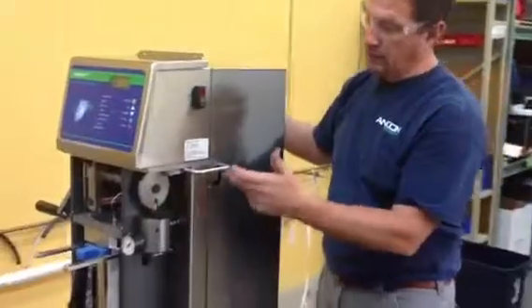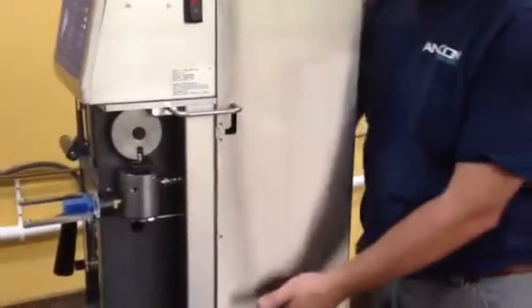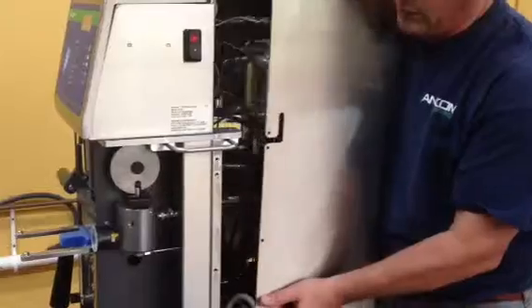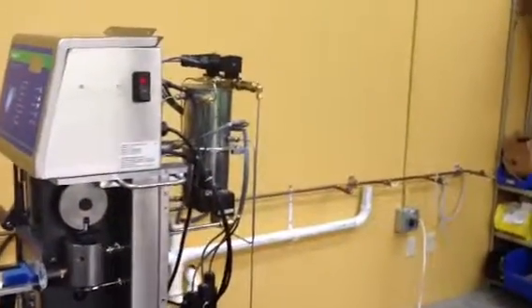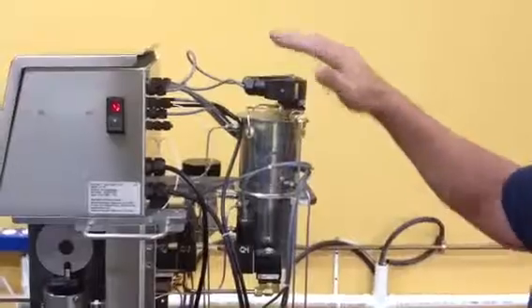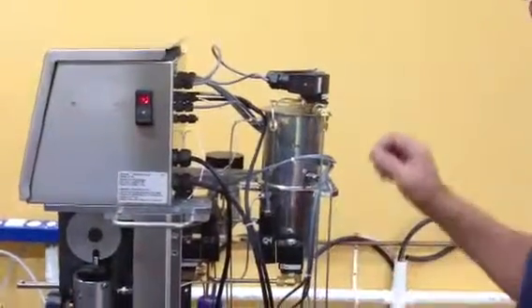On the back, you have to lift it up and over the handle, so there's a notch out here on the back. So basically, position your fingers underneath, lift up. As soon as you get it high enough, it should pull right straight off the back, exposing the back. Once you get to that point, I'd like you to start a run. You could even start the run before that, so it gives a little time to build up pressure.